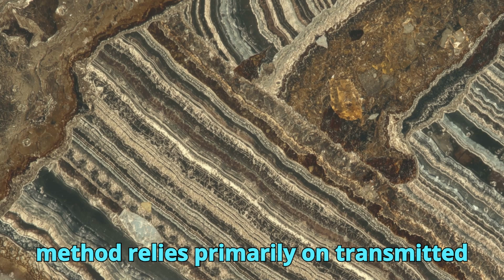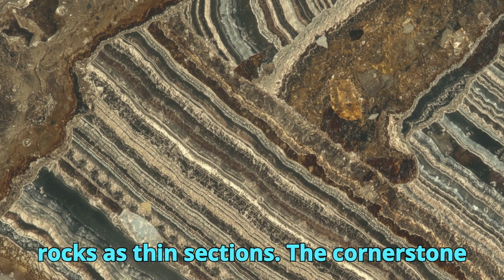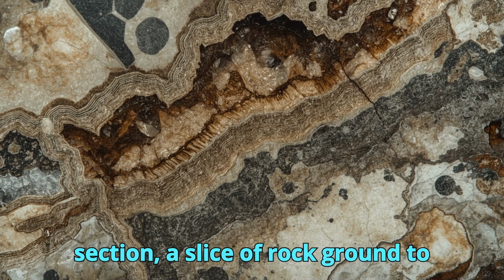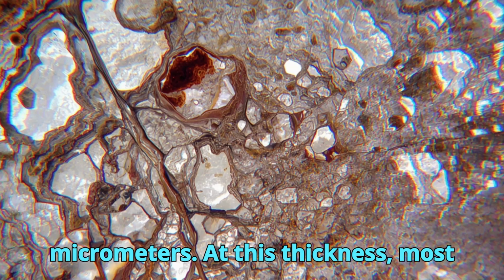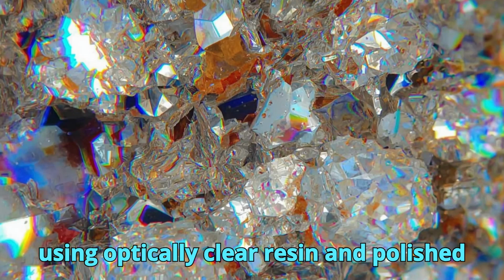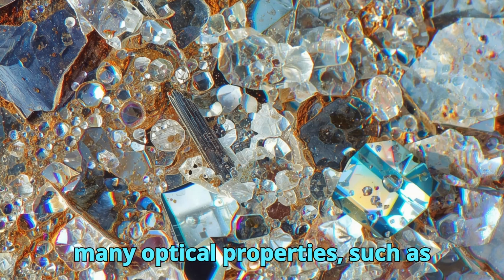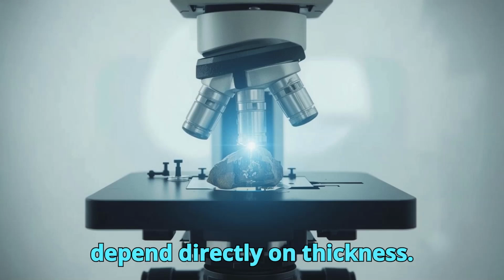This method relies primarily on transmitted light microscopy and the preparation of rocks as thin sections. The cornerstone of petrographic analysis is the thin section, a slice of rock ground to a standard thickness of approximately 30 micrometers. At this thickness, most minerals become translucent, allowing light to pass through them. Thin sections are typically mounted on glass slides using optically clear resin and polished to ensure uniform thickness. The standardized preparation is essential, as many optical properties, such as birefringence and interference colors, depend directly on thickness.